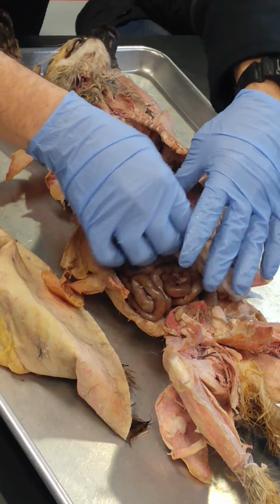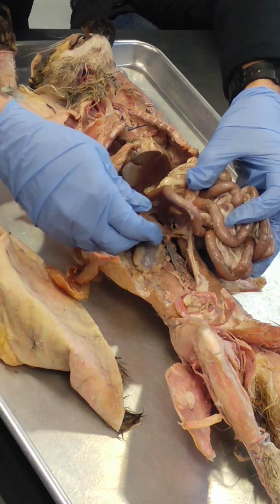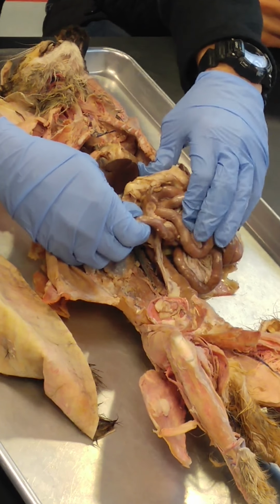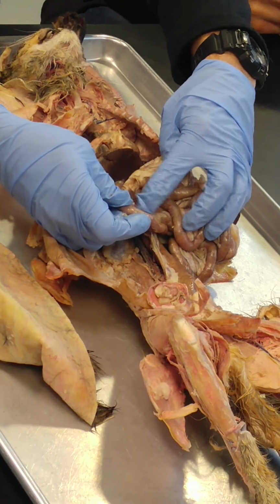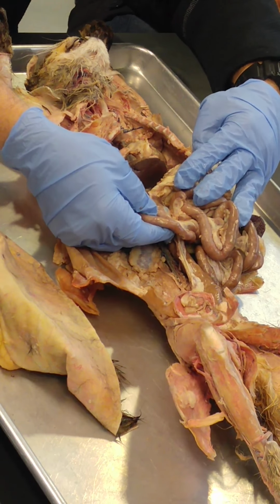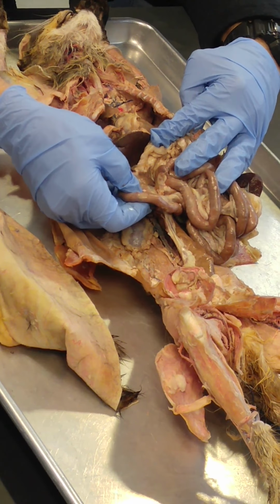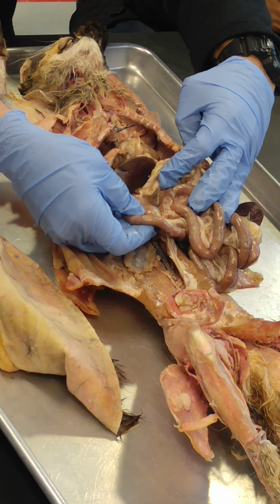All right. Pancreas. We've already talked about pancreas. You already know pancreas. Pancreas is in the curve of the duodenum. So the first part of the small intestine is the duodenum. There's the curve of the duodenum. It's only a foot long in humans, so it's not very long in cat, maybe about that long. But the pancreas is that glandular tissue that sits right there. So if I put my finger back there, you can see the blue. So this is duodenum, this is pancreas, and my finger is some more mesentery. Okay?